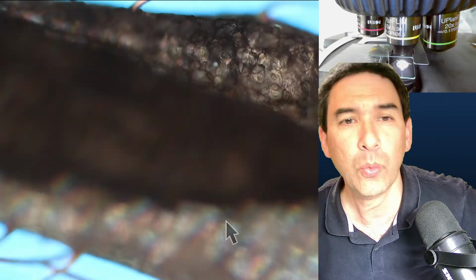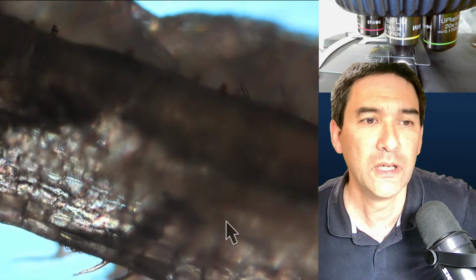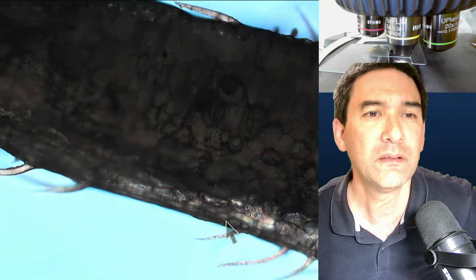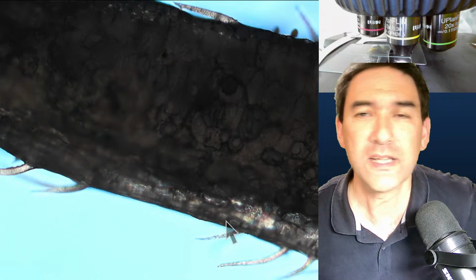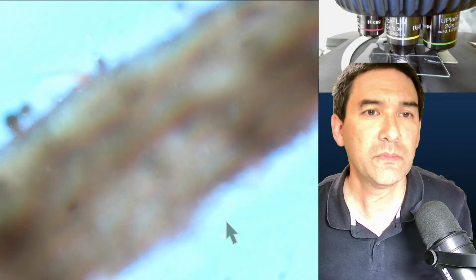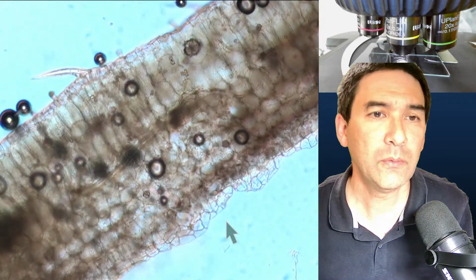Now let's have a look at the one where I did not add any water. Well, okay, of course, without water, it's already difficult. But you see, it's starting to dry up a little bit, and then it's going to start to shrivel up. And it's also quite dark. This has something to do with the refractive index as well. So this is basically just something that I wanted to show you.